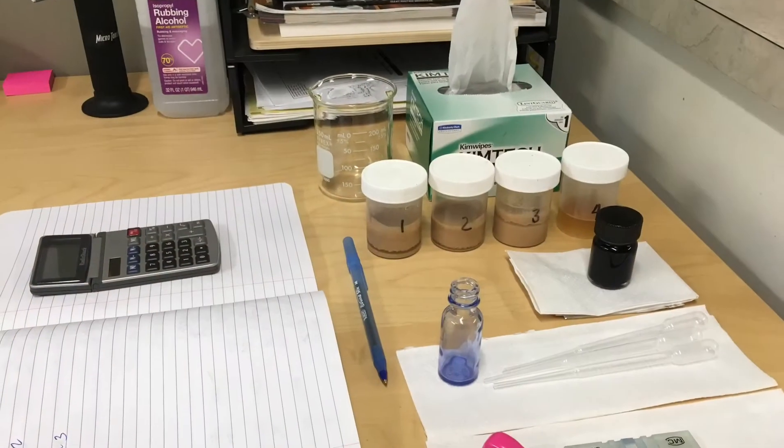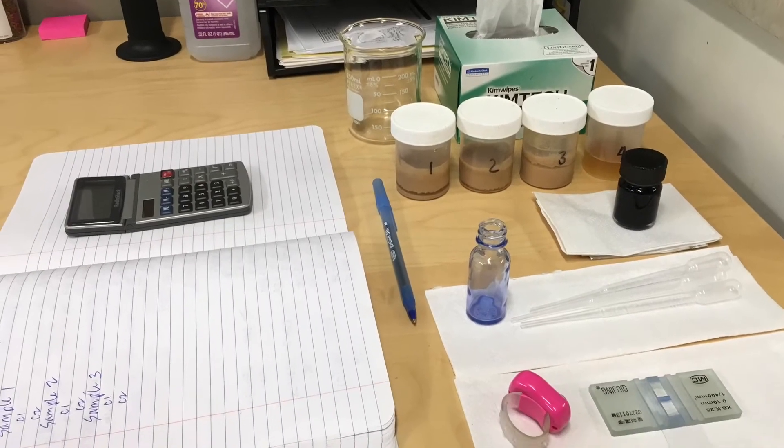All right, in this video we're going to be taking a look at a yeast sample and calculating its density and viability.